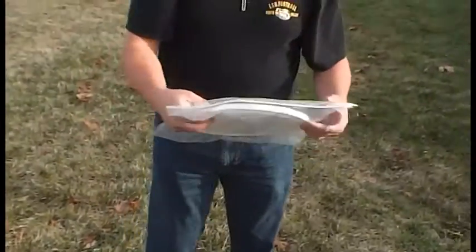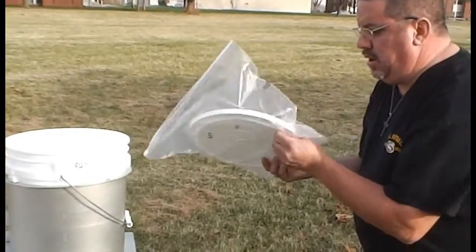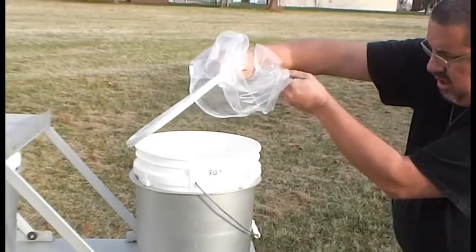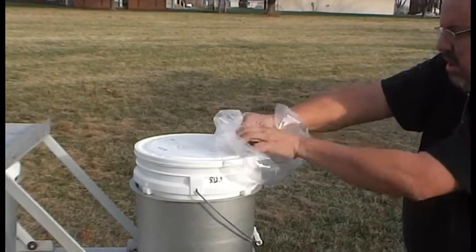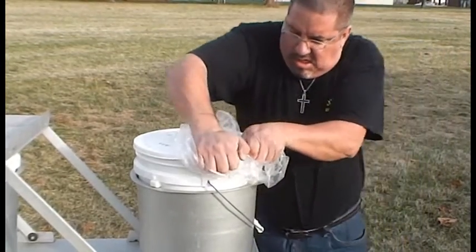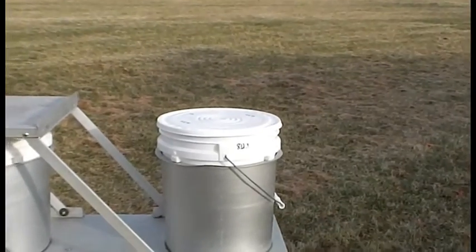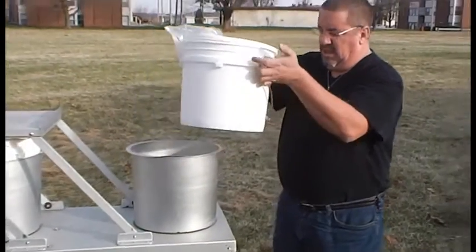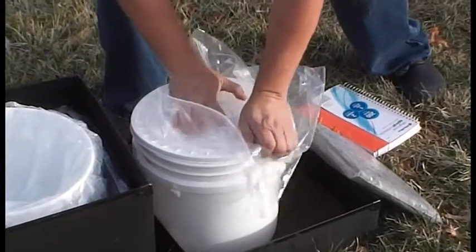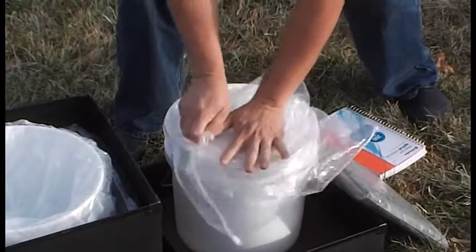To remove the old bucket, first locate and unzip the cleaned and sealed lid. Grasp the lid bag from the side opposite the zipper, then carefully pull the bag back over your hand and wrist until the lid is fully exposed and the seal side is facing downward. This will allow you to use the bag as a glove when placing the lid on the bucket. Securely and firmly place the lid over the open bucket using your bagged hand. Be sure not to touch the lip of the bucket or the underside of the lid with bare hands. Once the lid is in place, lift the sealed bucket from the holder and place it on a clean surface, keeping in mind that dirt and dust are difficult to remove during cleaning. Use the bag and your hands to press down on the lid and ensure it is firmly sealed onto the bucket.